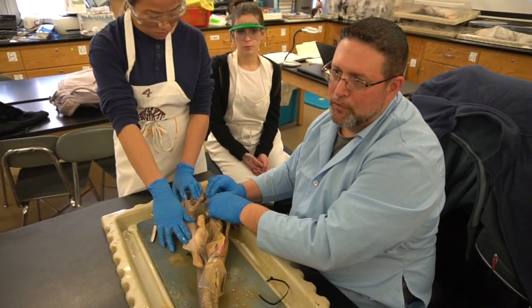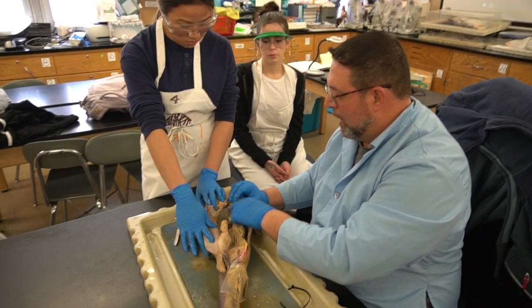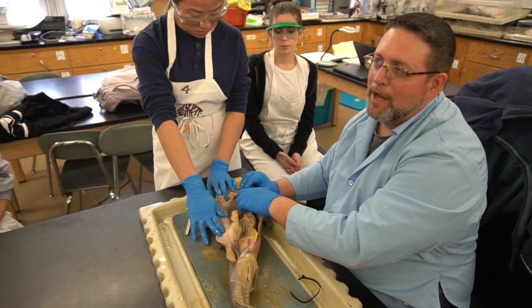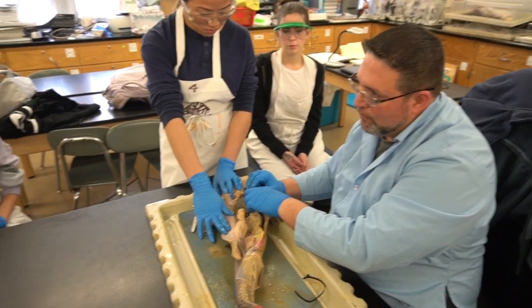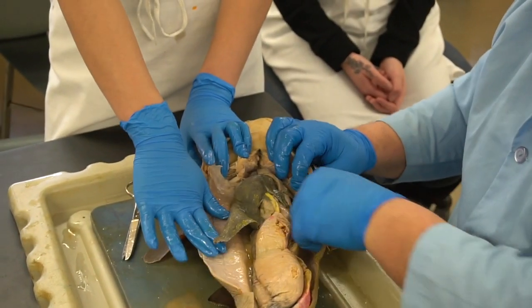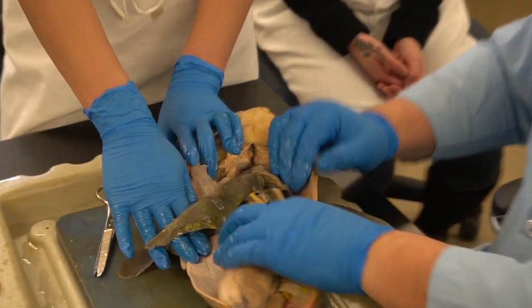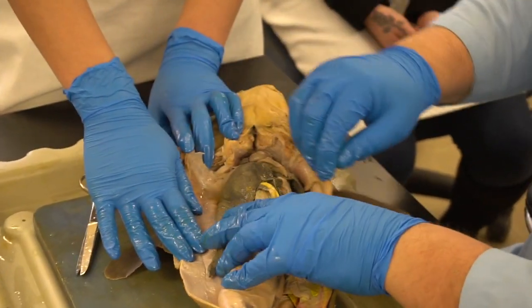Here we have a little bit different. It's a little bit of a lower vertebrate, so it's not as developed as us. However, blood leaving the heart to go to the body does leave through a similarly named artery, the aorta. We go down into the abdominal cavity. The largest, most prominent organ that you see here, and it's really large because part of it's hanging under here, is the liver. Okay, it has 3 lobes.